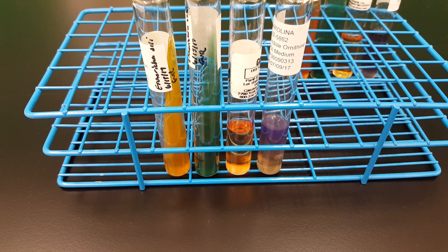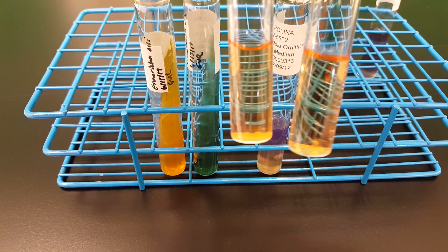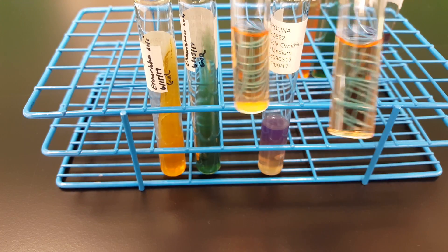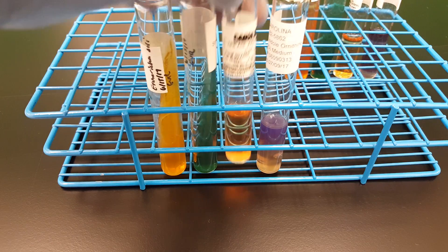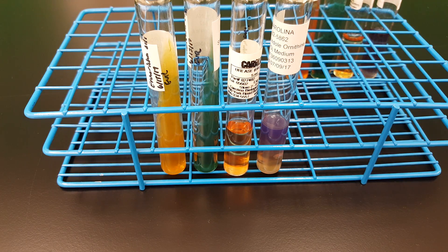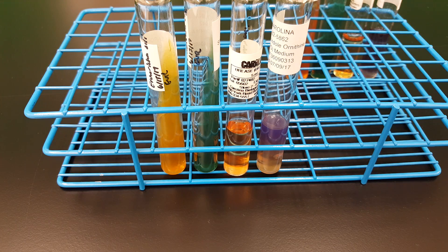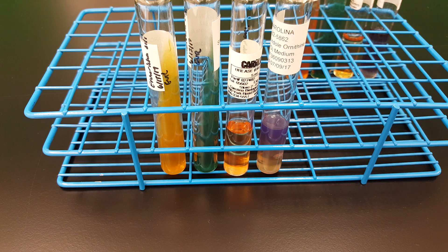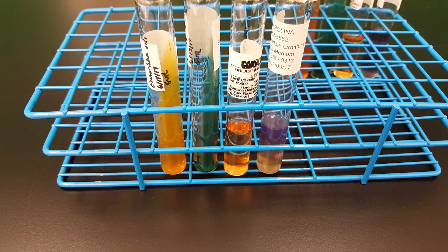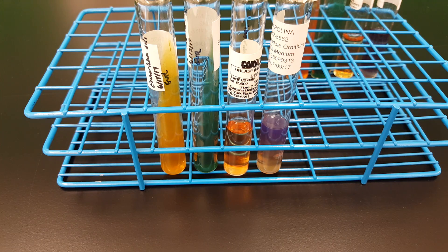The next tube we're looking at is the urease broth, and this looks exactly the same as the previous one — there is no color change, which indicates a negative reaction. So E. coli does not produce urease. If urease was produced, what would happen is there would be an alkaline environment formed due to ammonia, which is the byproduct of the utilization of urea. The phenol red indicator in the tube would then change to a red color, and we will see that production with Proteus and Morganella morganii.